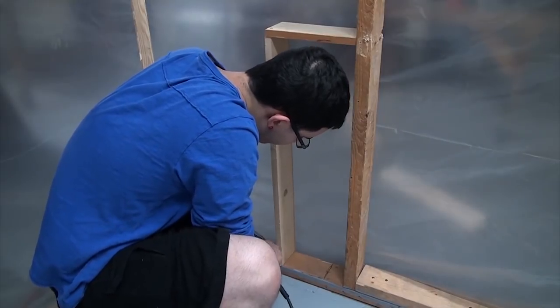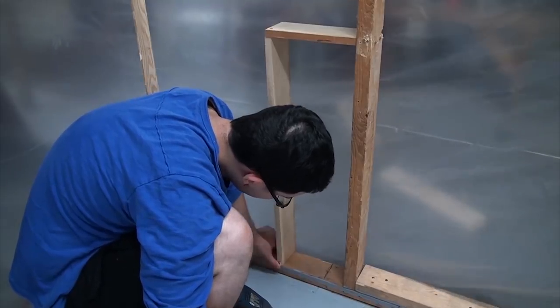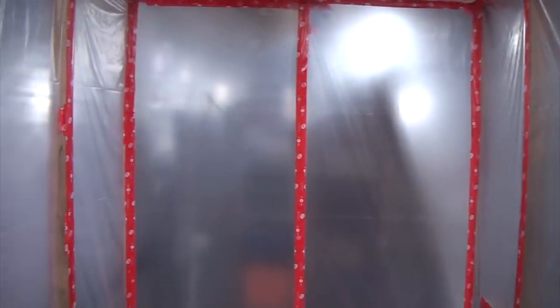One last touch before we finish putting up the plastic was to install these wooden boxes. They're designed to fit our air filtration unit, and I added an extra one in case we feel we need to add more airflow later. With those in the door installed, the remaining plastic could be hung on the outside, and the inside walls could be finished.